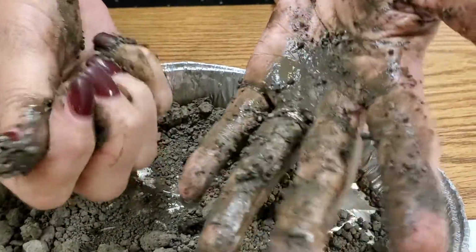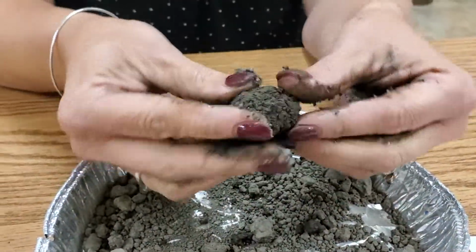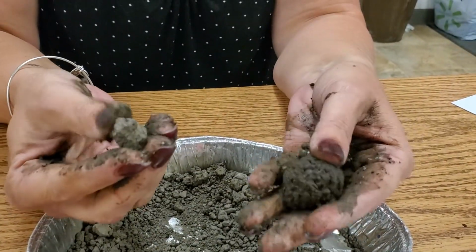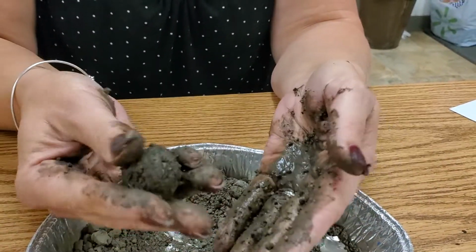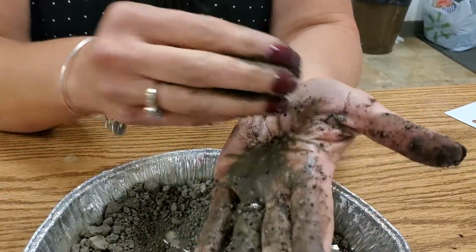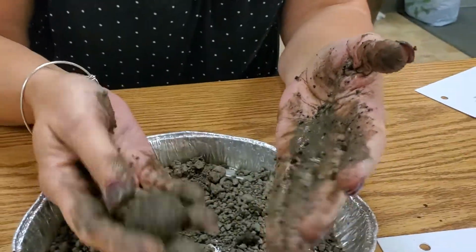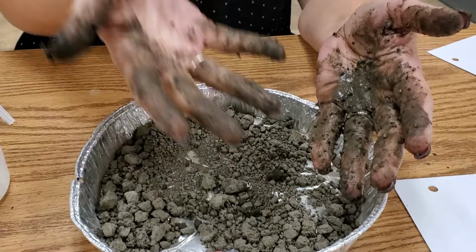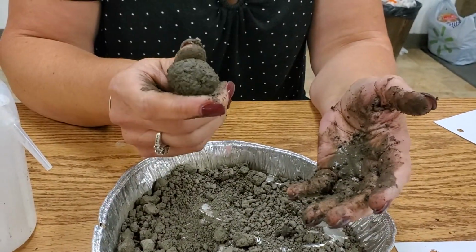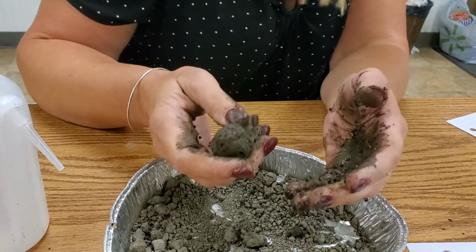And it's sticky. Anything that leaves that kind of residue is sticky, forms a beautiful, perfect ball like that, and has hard clods like this. You know it's that other class of clay category. But we can go ahead and walk through this class. Everywhere that you just gently touch, it's leaving that clay residue. So we do the ball test, and it doesn't budge. If you have to throw a clod at a sibling or a friend, this is the one to do, because clay is going to hold its shape for a really long distance.